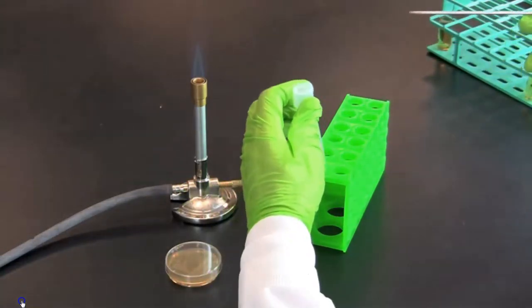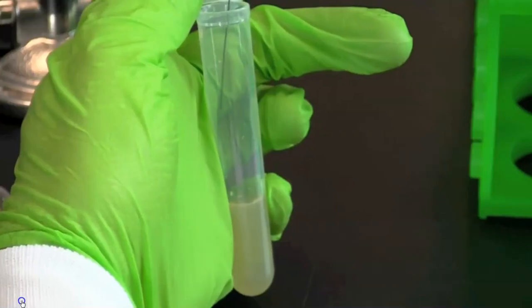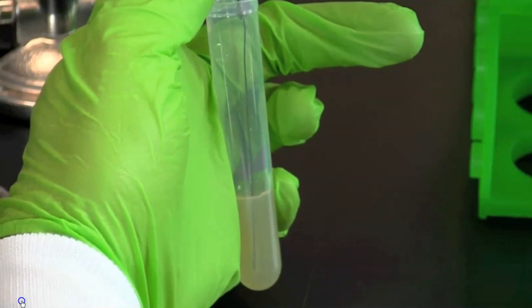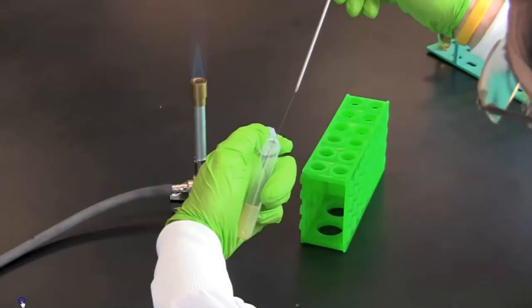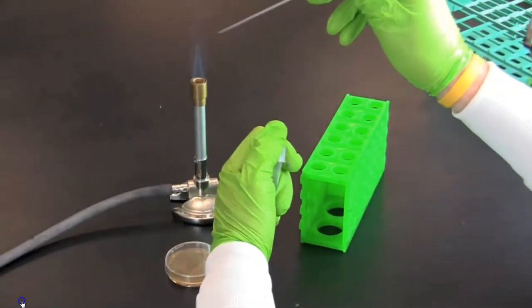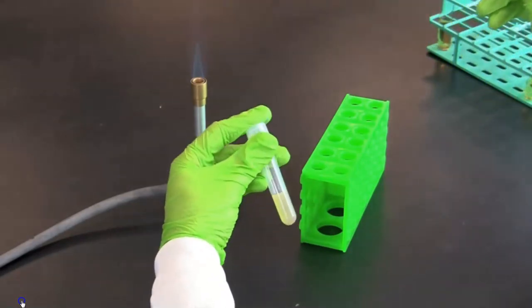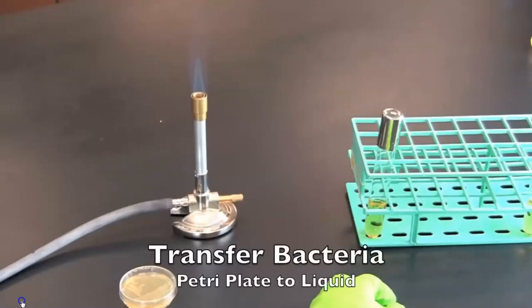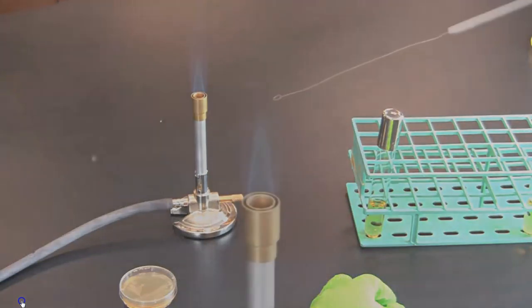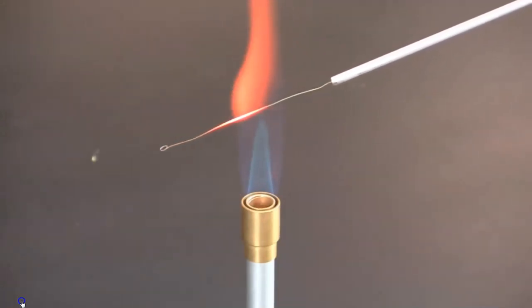Transfer the bacteria to a culture tube filled with nutrient agar. Remove the top of the tube and insert the needle, making 3 deep stabs. When finished, replace the lid on the tube and sterilize the needle. In this section, you will learn how to transfer bacteria from a petri plate to a liquid. Sterilize an inoculation loop by passing it through a flame.